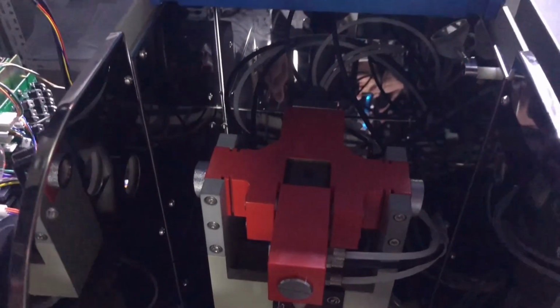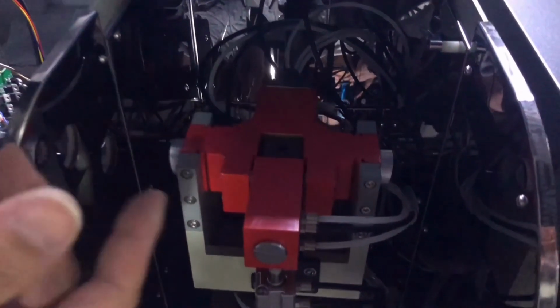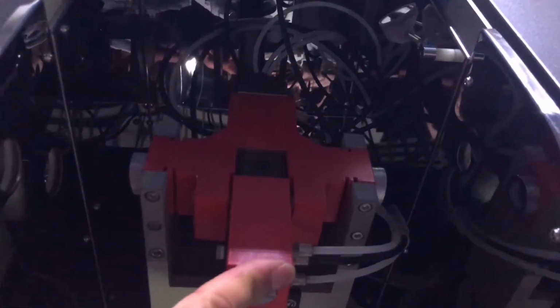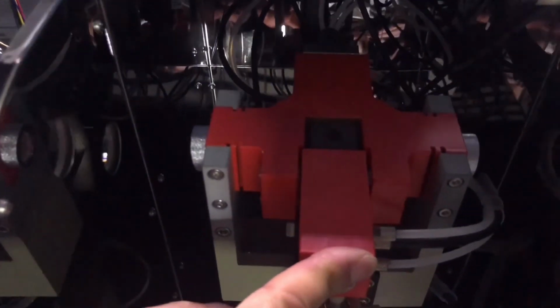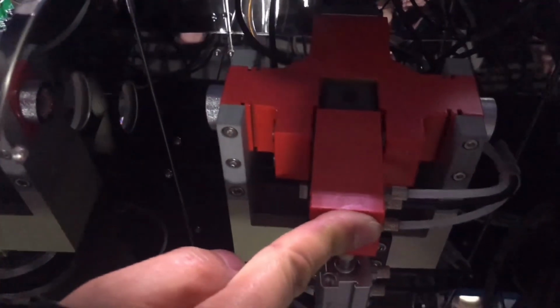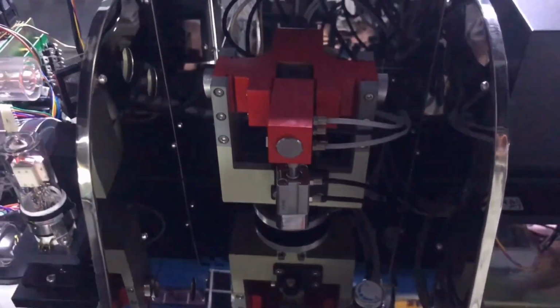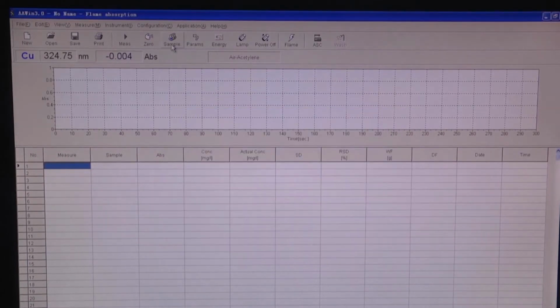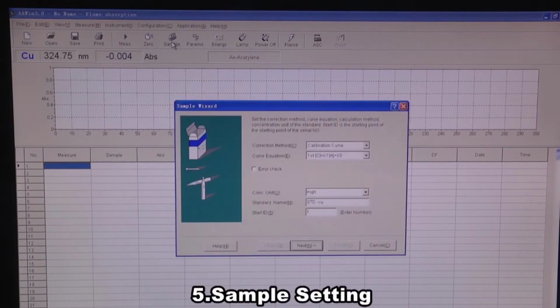From the software, you could check the energy of the instrument. You may align the position of the graphite furnace to get the highest energy. Above is the alignment procedure for the graphite tube. Now the instrument is ready to use. Next is to set up sample. I simply press this button.